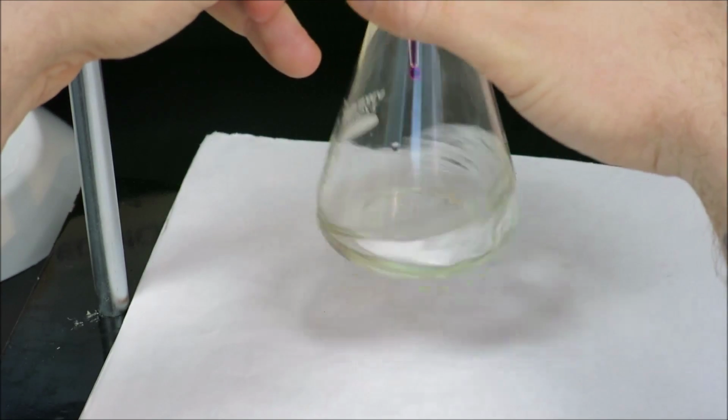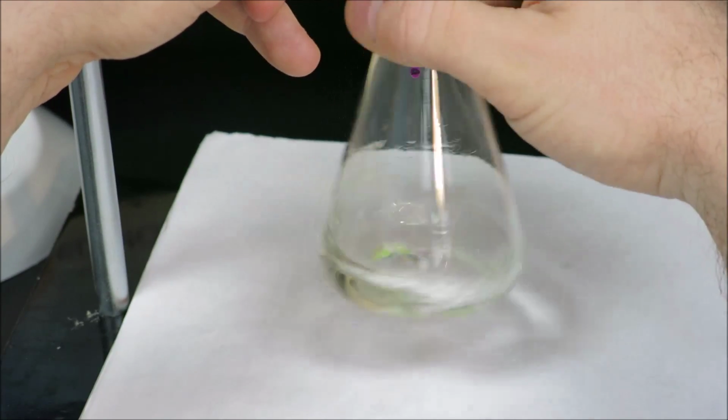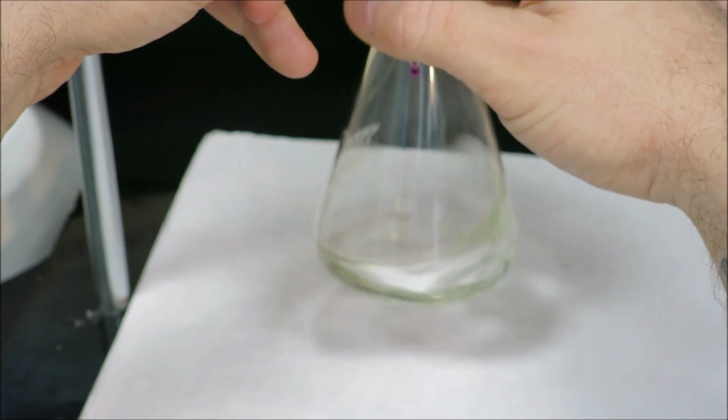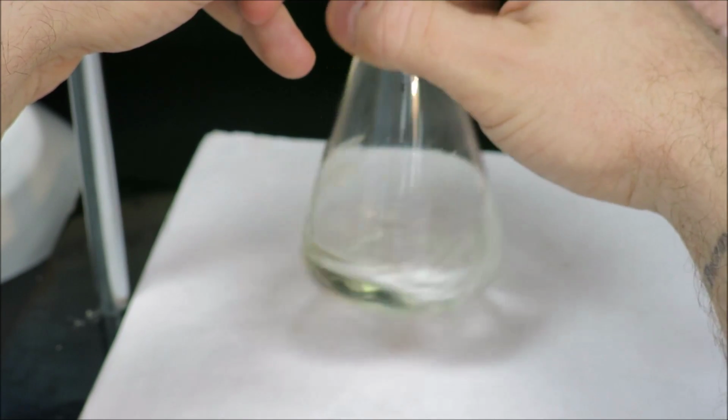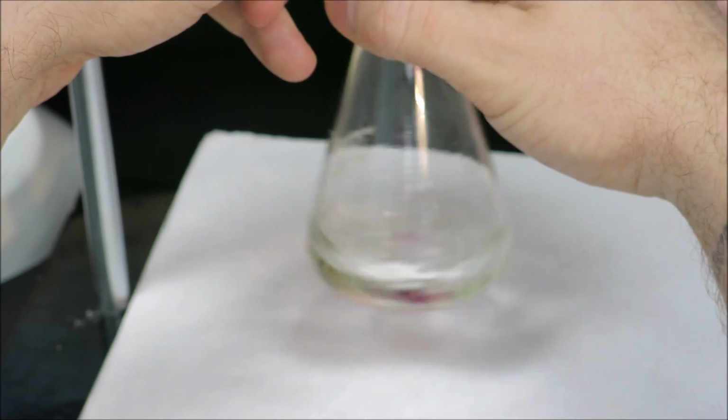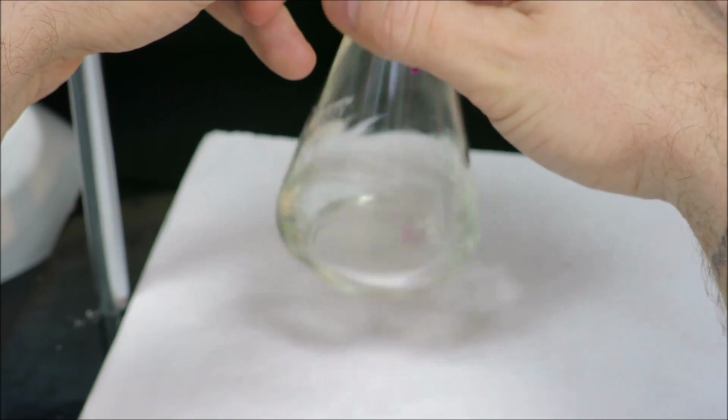And if perchance a small drop touches the side of the flask, what I can do is use a wash bottle and just rinse the drop into the actual mixture. I need to rinse any drops that have exited the burette into the mixture because that could be the difference in reaching the equivalence point.